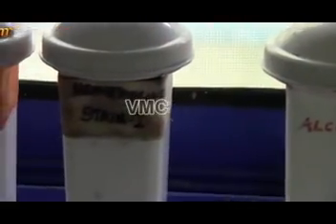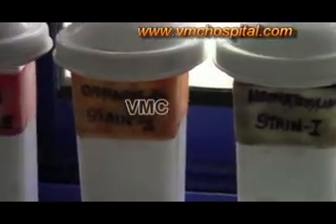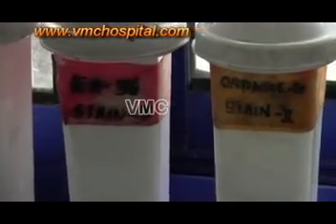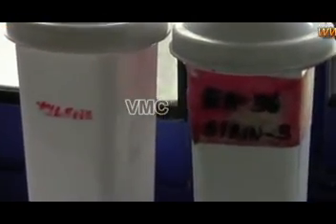For morphology, the smear is sent through different media. The initial smear is kept in ethyl alcohol for 1 hour.